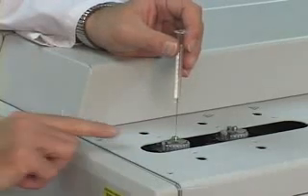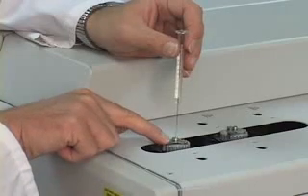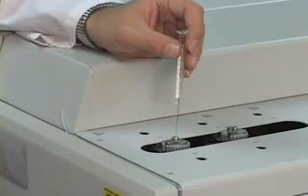This injector port is heated to about 200 degrees Celsius. This particular one consists of a tripod that, when depressed, initiates the run.